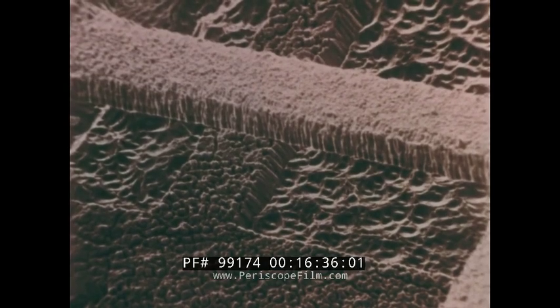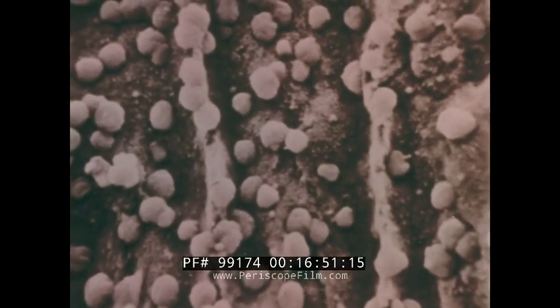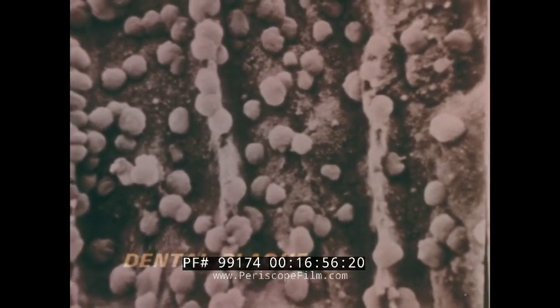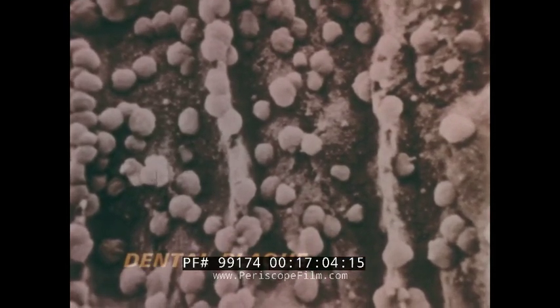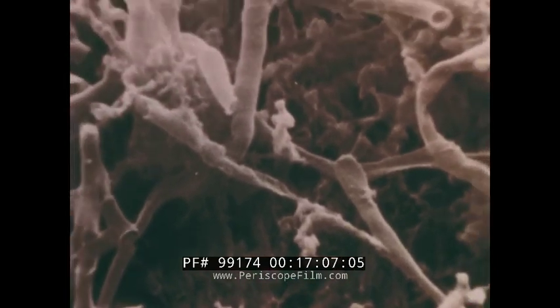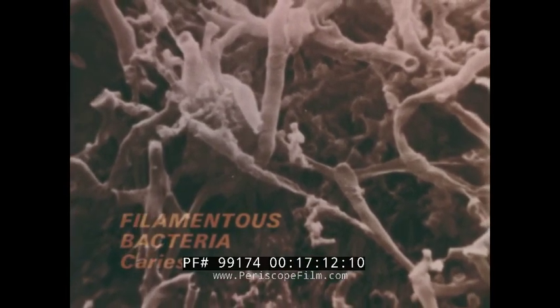This looks like an archaeological dig. It's an ion-etched piece of tooth enamel, showing the various layers as they are excavated for study. This is part of the dental picture, too. It's a plaque scraped from the enamel wall. And the spheres are one kind of bacteria not yet identified, found in association with human teeth. And this is another, filamentous kind of bacteria from a carious lesion.